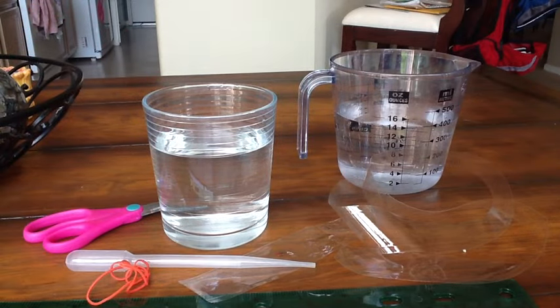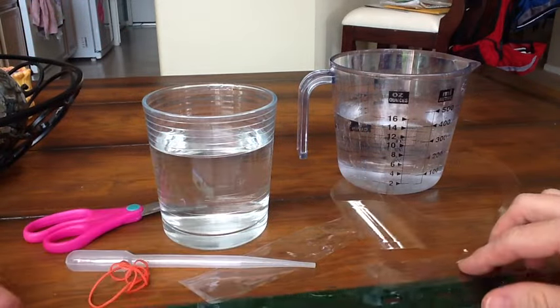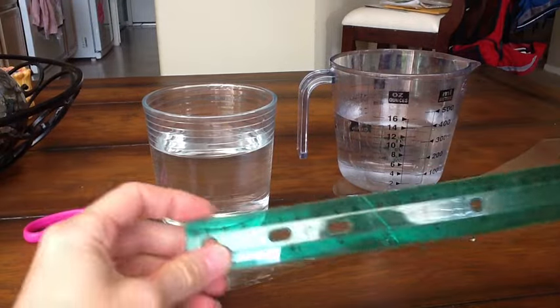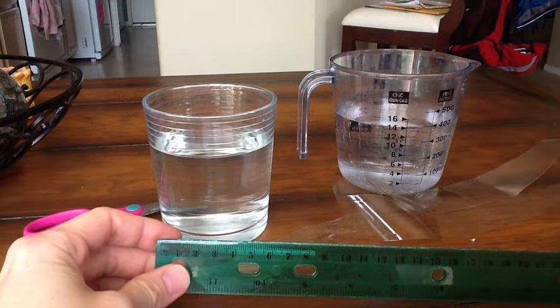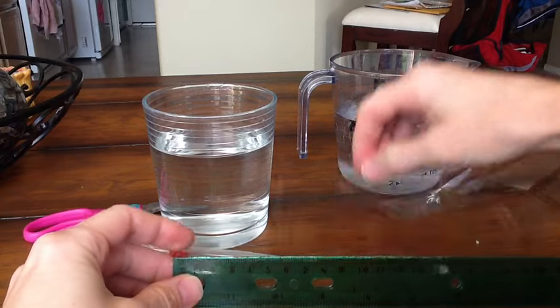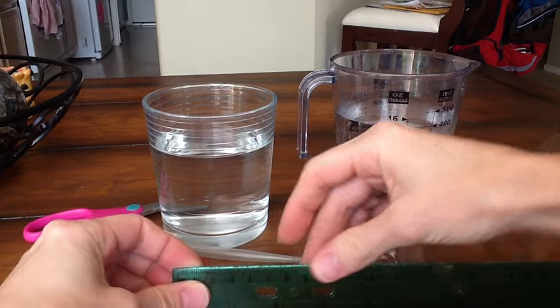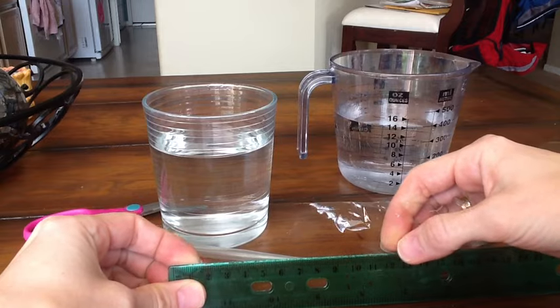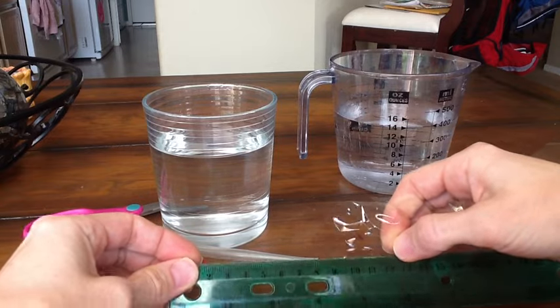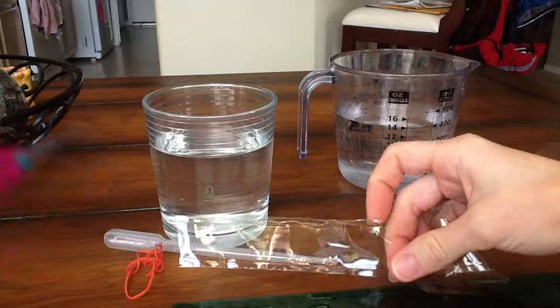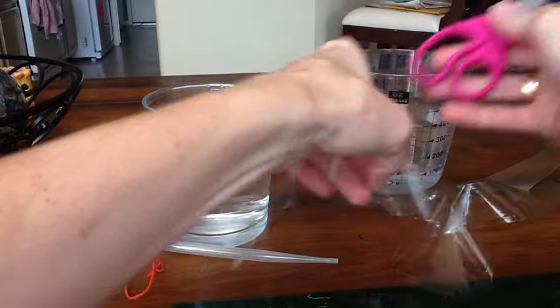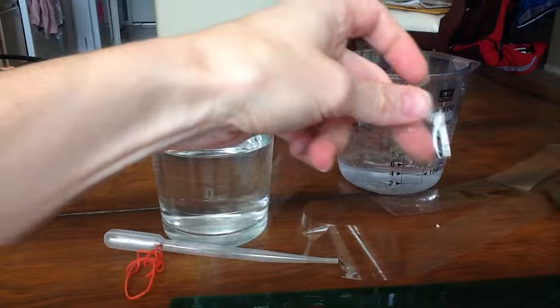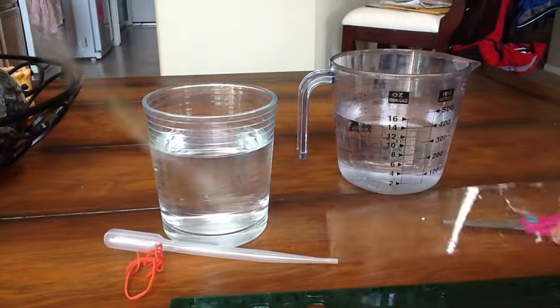Okay, so let's get started. The first thing that we're going to do for this lab is we're going to use our ruler here to cut about 12 centimeters of the dialysis tubing. So I'm just going to hold up the dialysis tubing here. Your dialysis tubing might be a lot more thin than this dialysis tubing. This is kind of thick, so the width that you need for the experiment is your own choice.